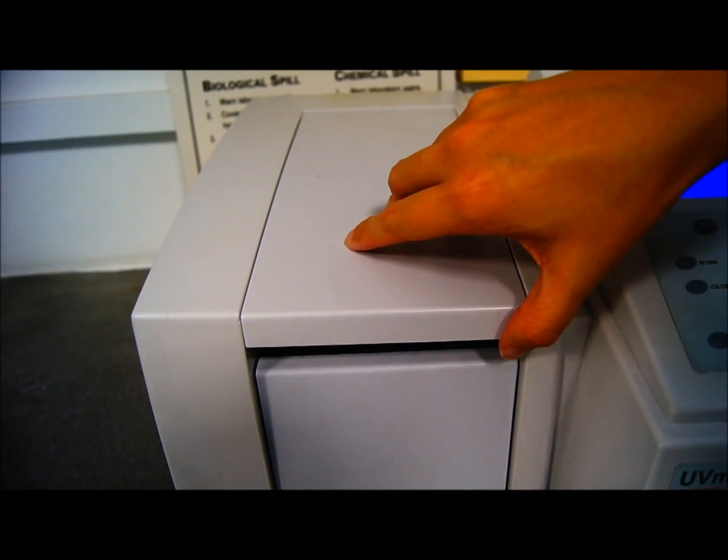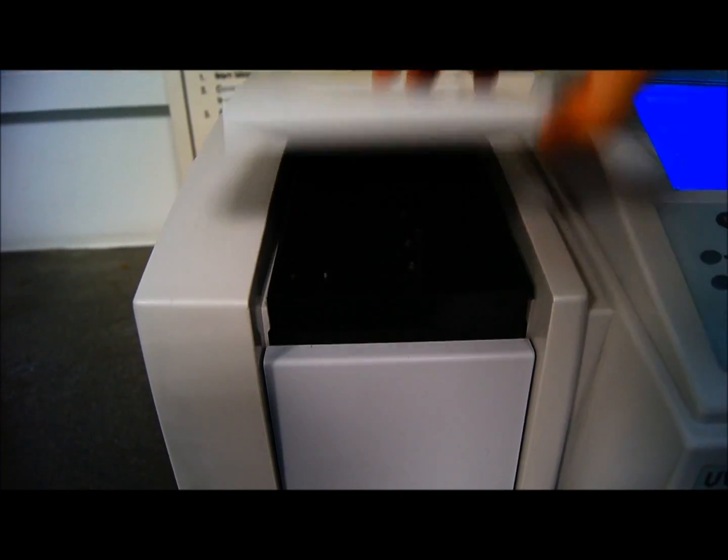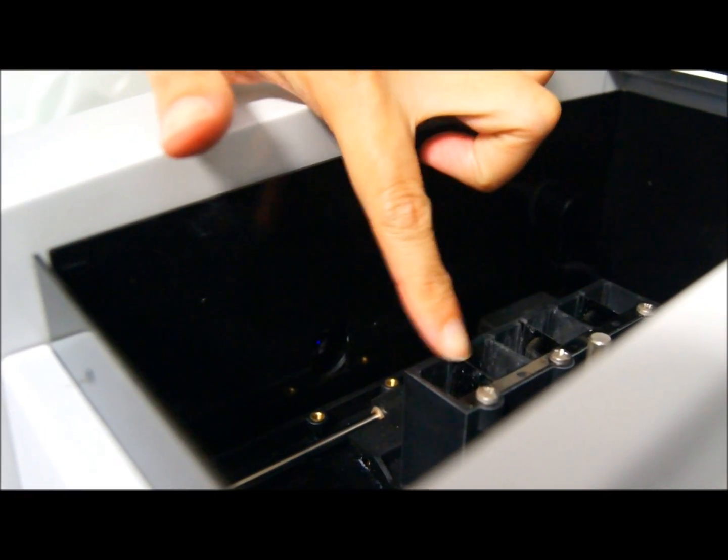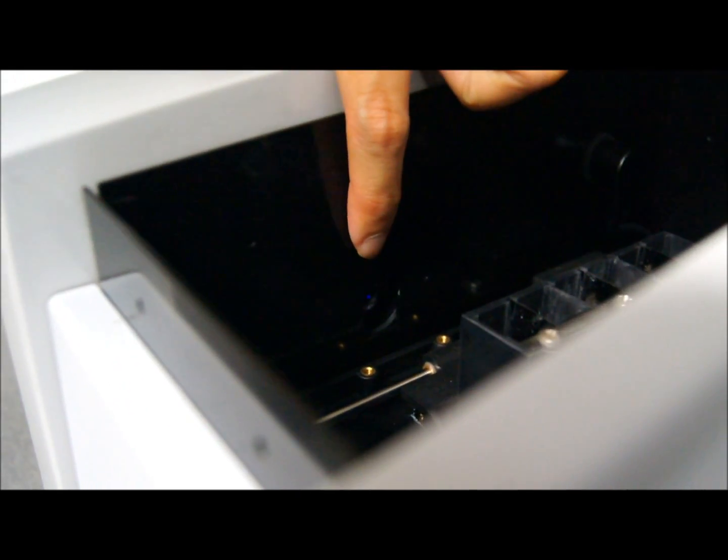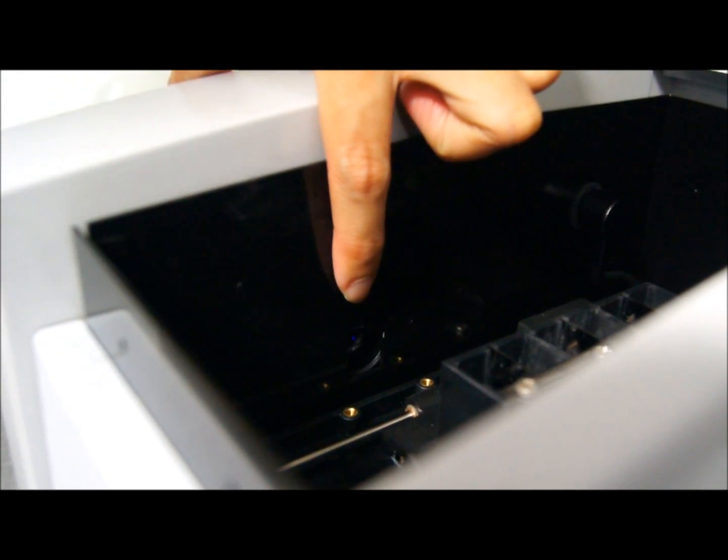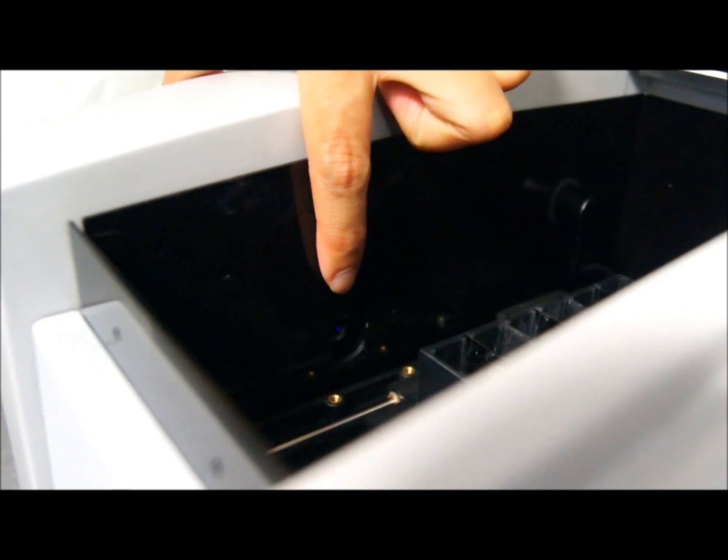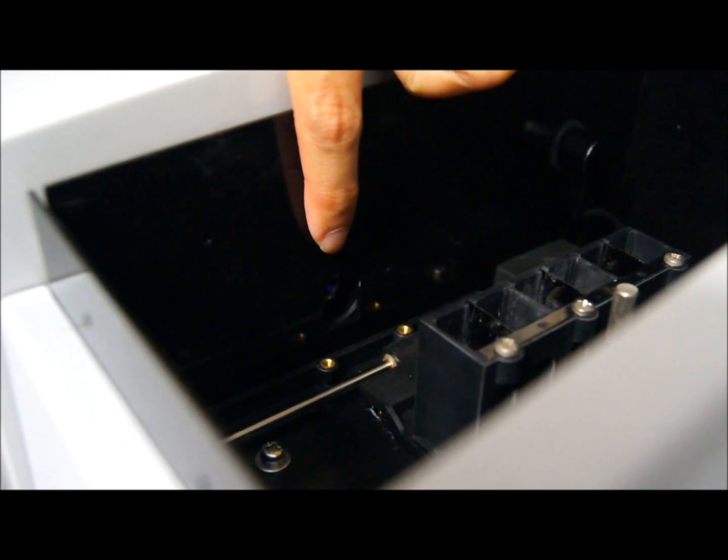This is what we see inside the spectrophotometer and this is where we put the cuvettes. These will be the slots in which we put the cuvettes, and you can see this little hole at the side is where the light would come out from of that particular wavelength that you set the spectrophotometer at.